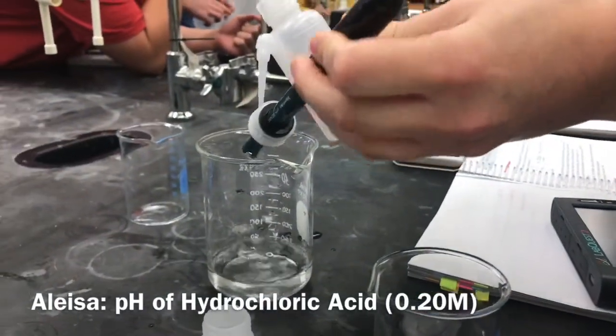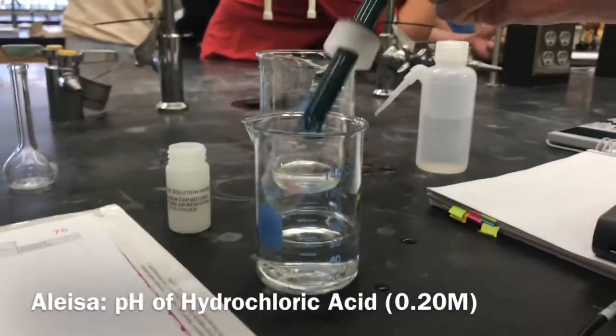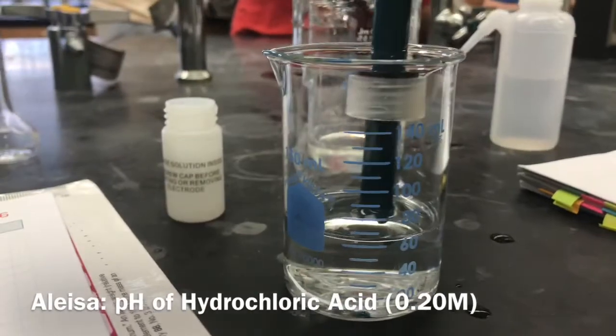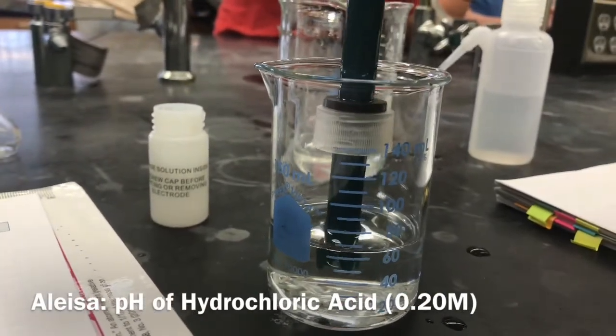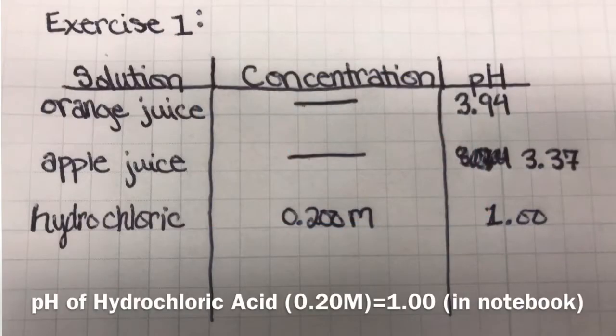Next, we use the pH meter to determine the pH of hydrochloric acid, which has a concentration of 0.20 molarity. We first rinse the electrode, then immerse it in the hydrochloric acid. Then, we wait for the pH to steady out and record the value in our notebook.